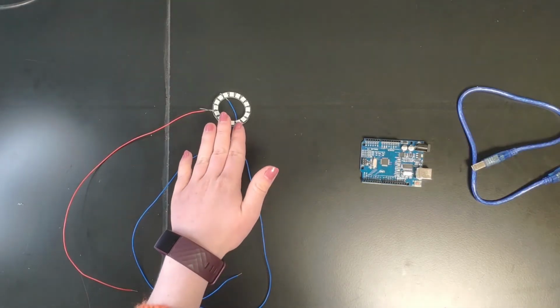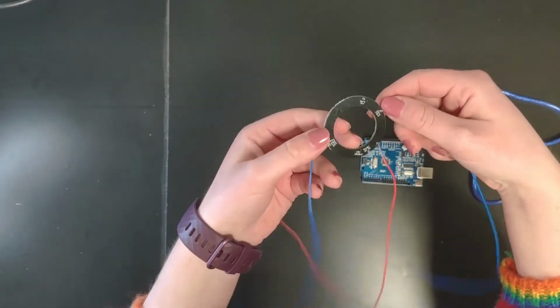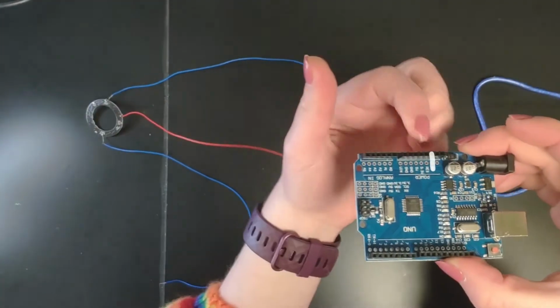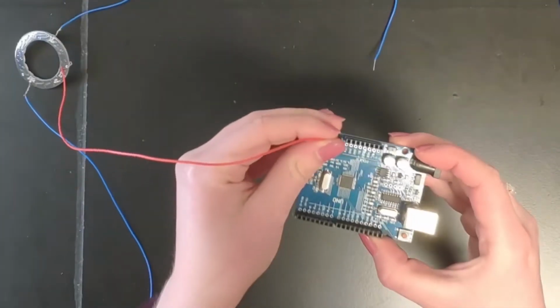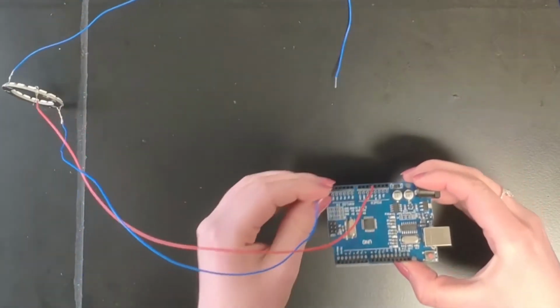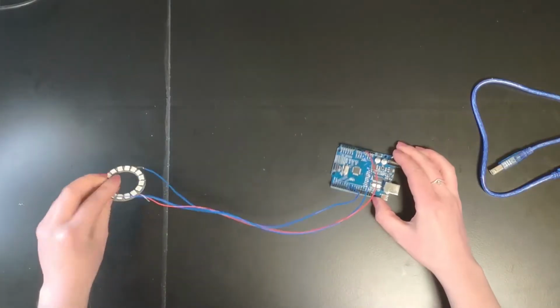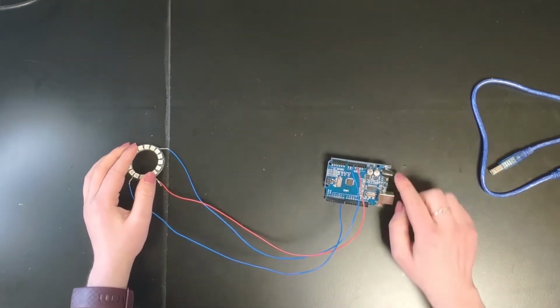So first I'm going to show you how to wire up the pixel ring to the Arduino. So the pixel ring has 3 pins. It has a 5-volt pin, a ground pin, and a data pin or digital pin. So the Arduino also has a 5-volt, ground, and digital pins here. So we're going to put the 5-volt pin into the 5-volt on the Arduino, the ground pin into the ground pin on the Arduino, and the digital pin into digital pin 6 on the Arduino. Could be any pin, but in the code we have specified it goes into digital pin 6.